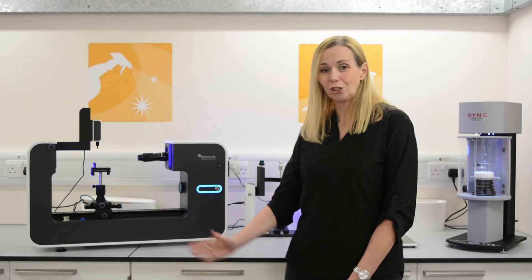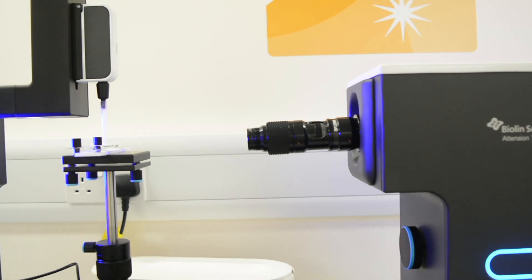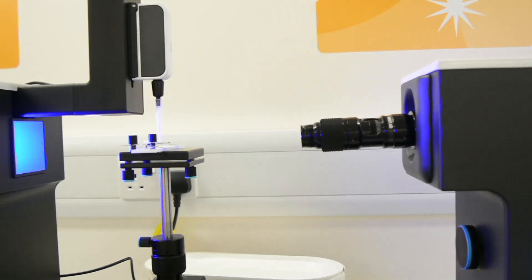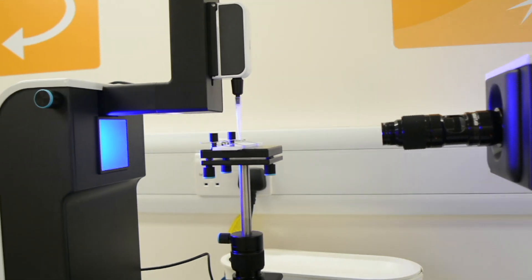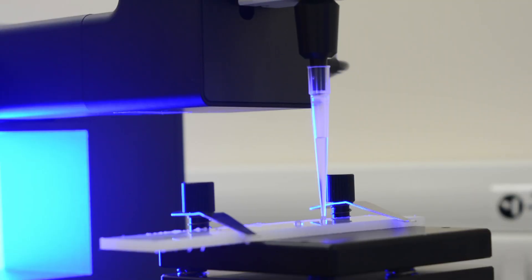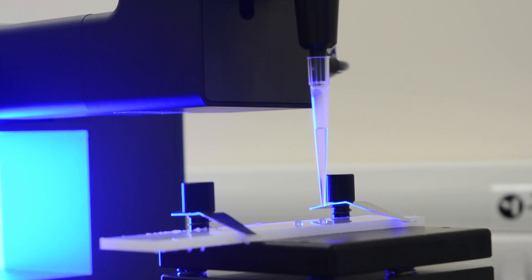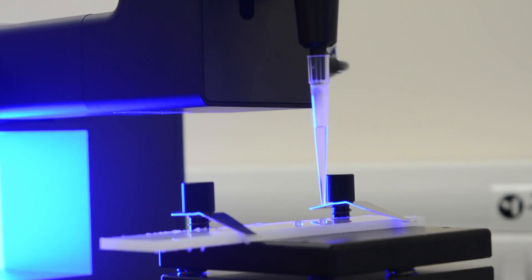You can also measure surface tension using an optical tensiometer if you only have a small amount of liquid available. By analysing the shape of a liquid droplet using advanced camera techniques, you can determine the droplet's profile and calculate the surface tension.